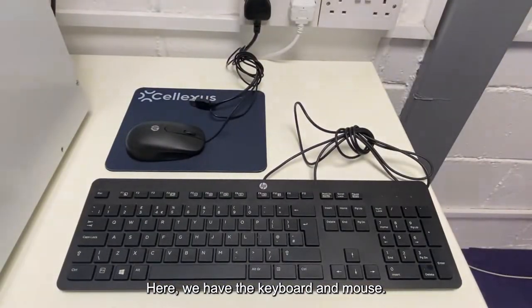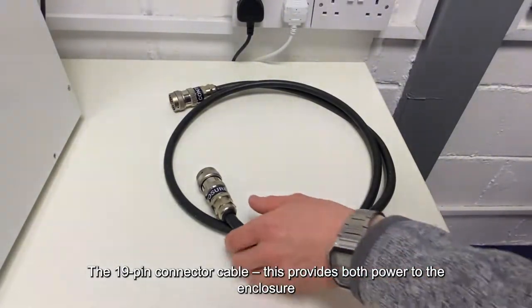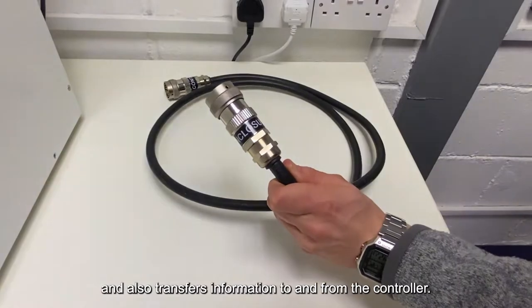Here we have the keyboard and mouse, the 19-pin connector cable. This provides both power to the enclosure and also transfers information to and from the controller.